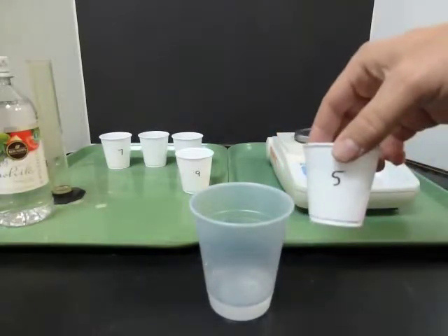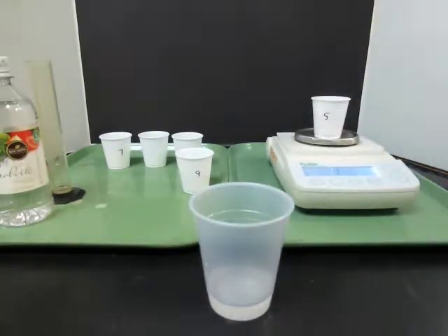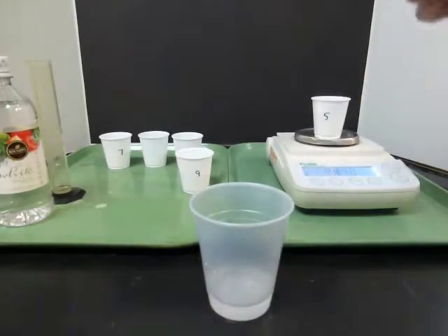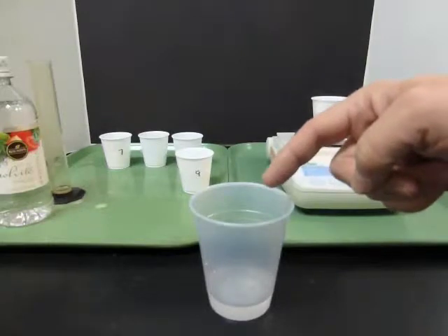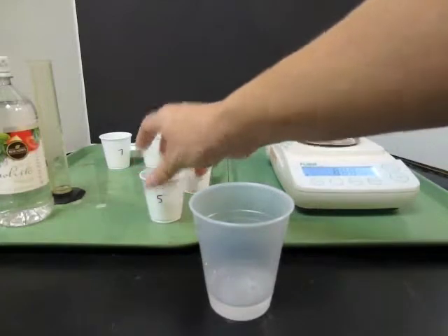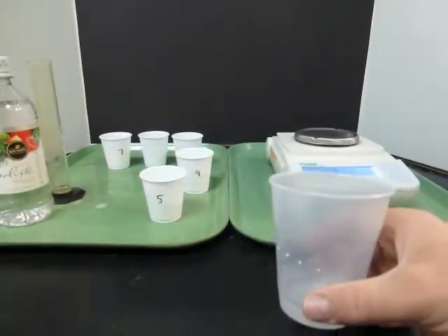I want to know how much baking soda I added. So I'll put this back on the balance and I'll re-weigh it. I'll subtract to find out how much I used. And using stoichiometry calculations, we'll figure out then how much acid was in the cup. When you're all done, just put the baking soda cup back. You don't have to dump it out or throw it away. But this cup can get poured in the sink and throw it in the trash.